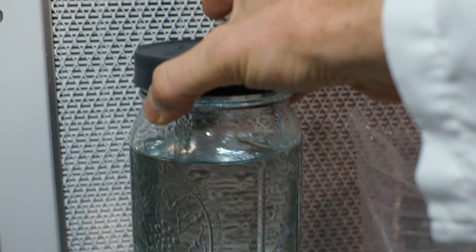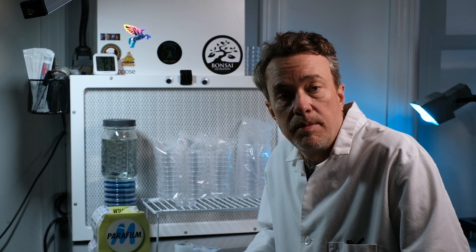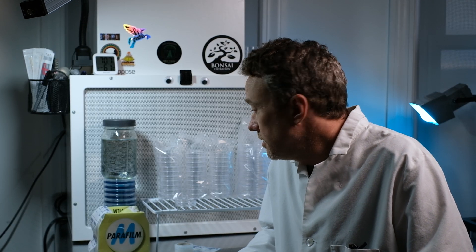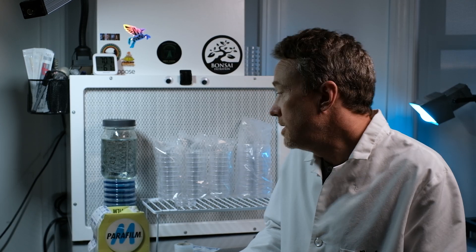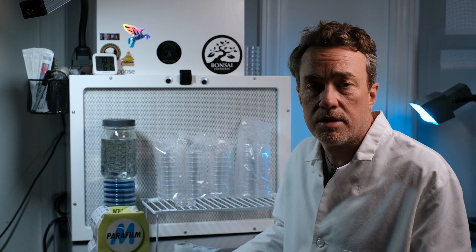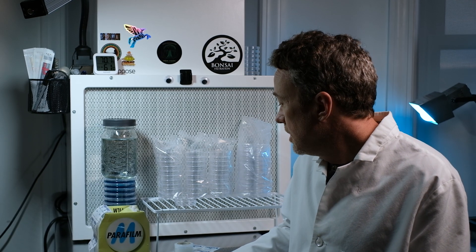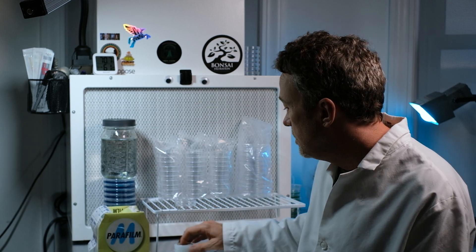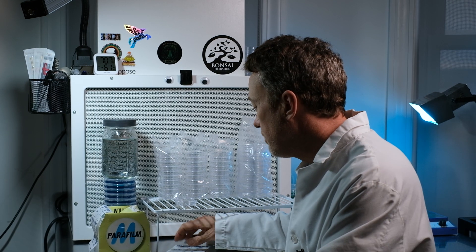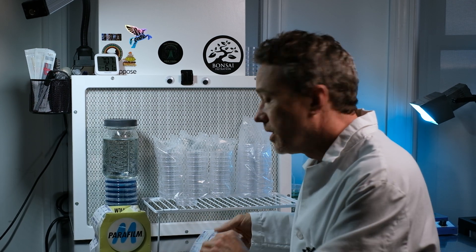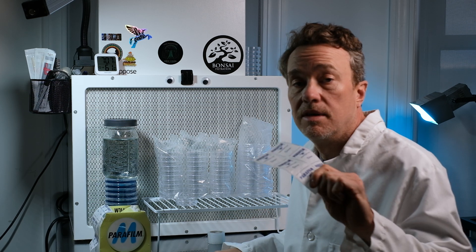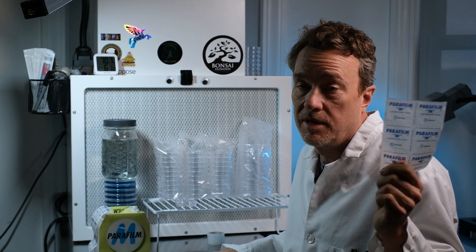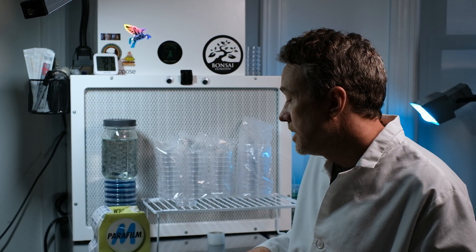Okay guys, so that's about it. Not too difficult—just a couple things to think about. Anytime you're working with open plates, you've got to be extra careful and extra clean. If you do that, you'll have great success. One last thing I wanted to touch on is how to wrap your plates when you are done pouring them. Lab standard has been parafilm, is, and probably always will be for a very long time.